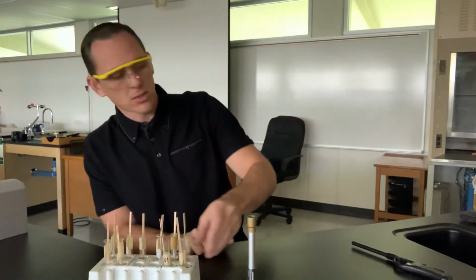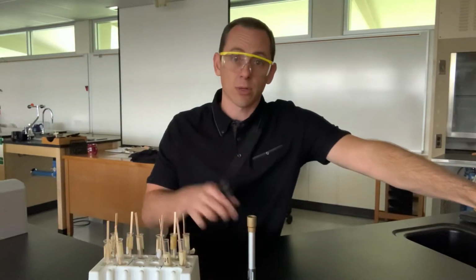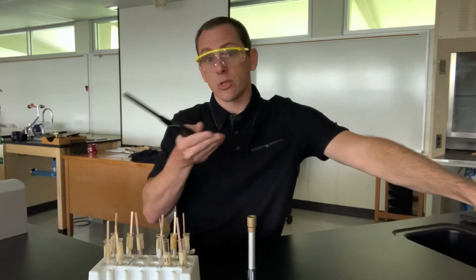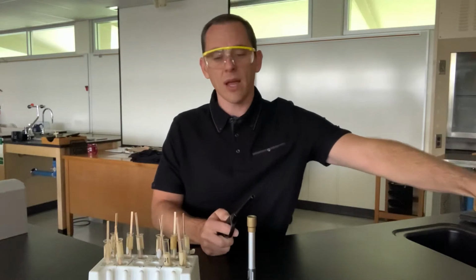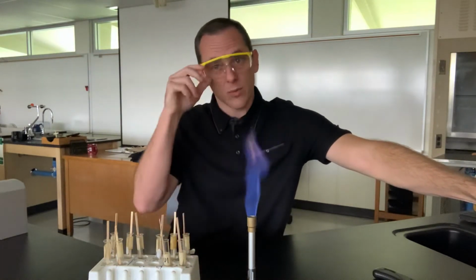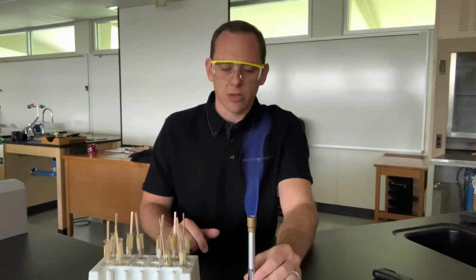So what I'm going to do is light the Bunsen burner, and I'm going to be using the heat from the Bunsen burner to excite the electrons. So it should go in as heat, the electrons should get excited, drop back down, and re-emit that as a new color of light that's unique to the element. So we go ahead and light the Bunsen burner, and we see that the Bunsen burner does have a little bit of that natural characteristic blue.